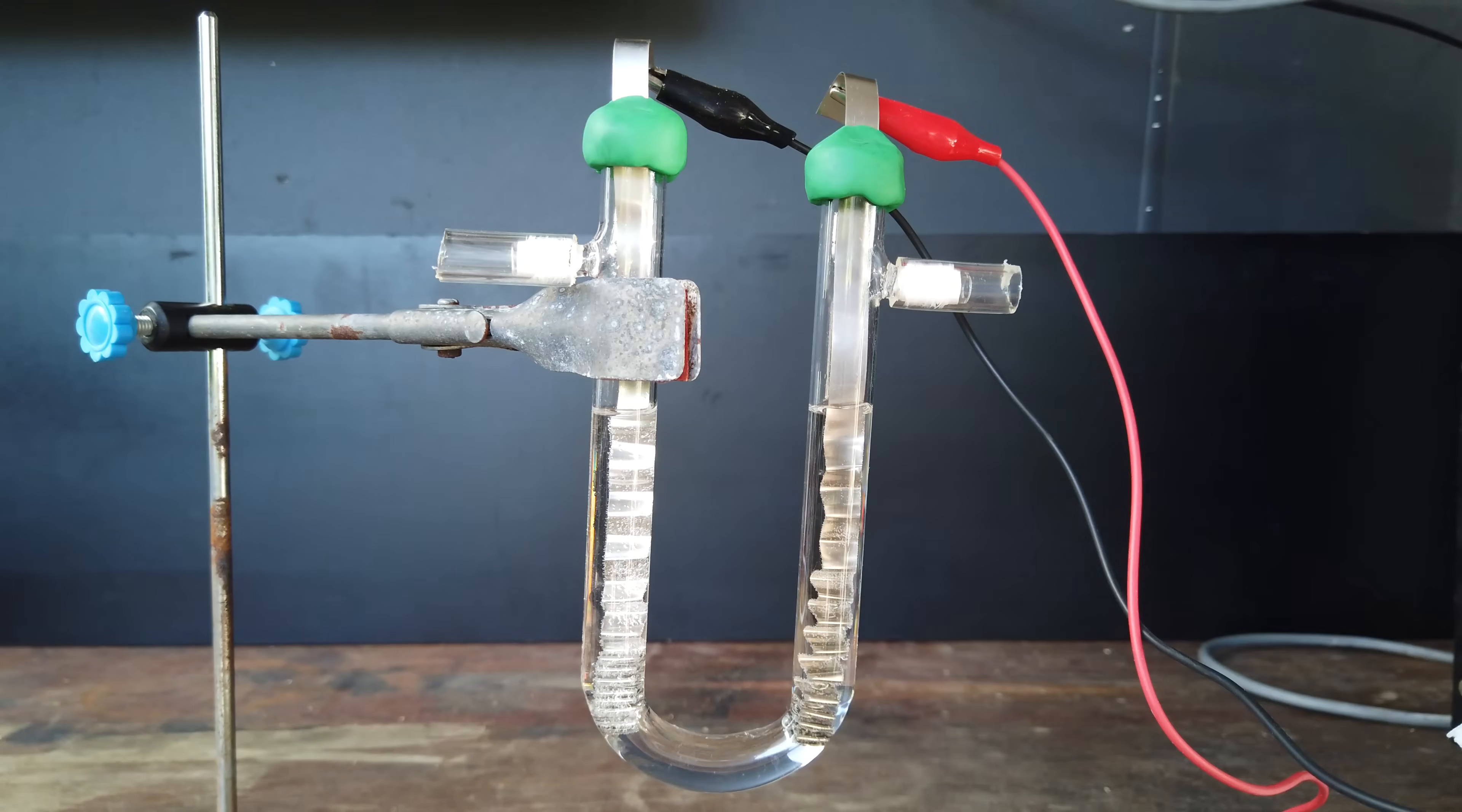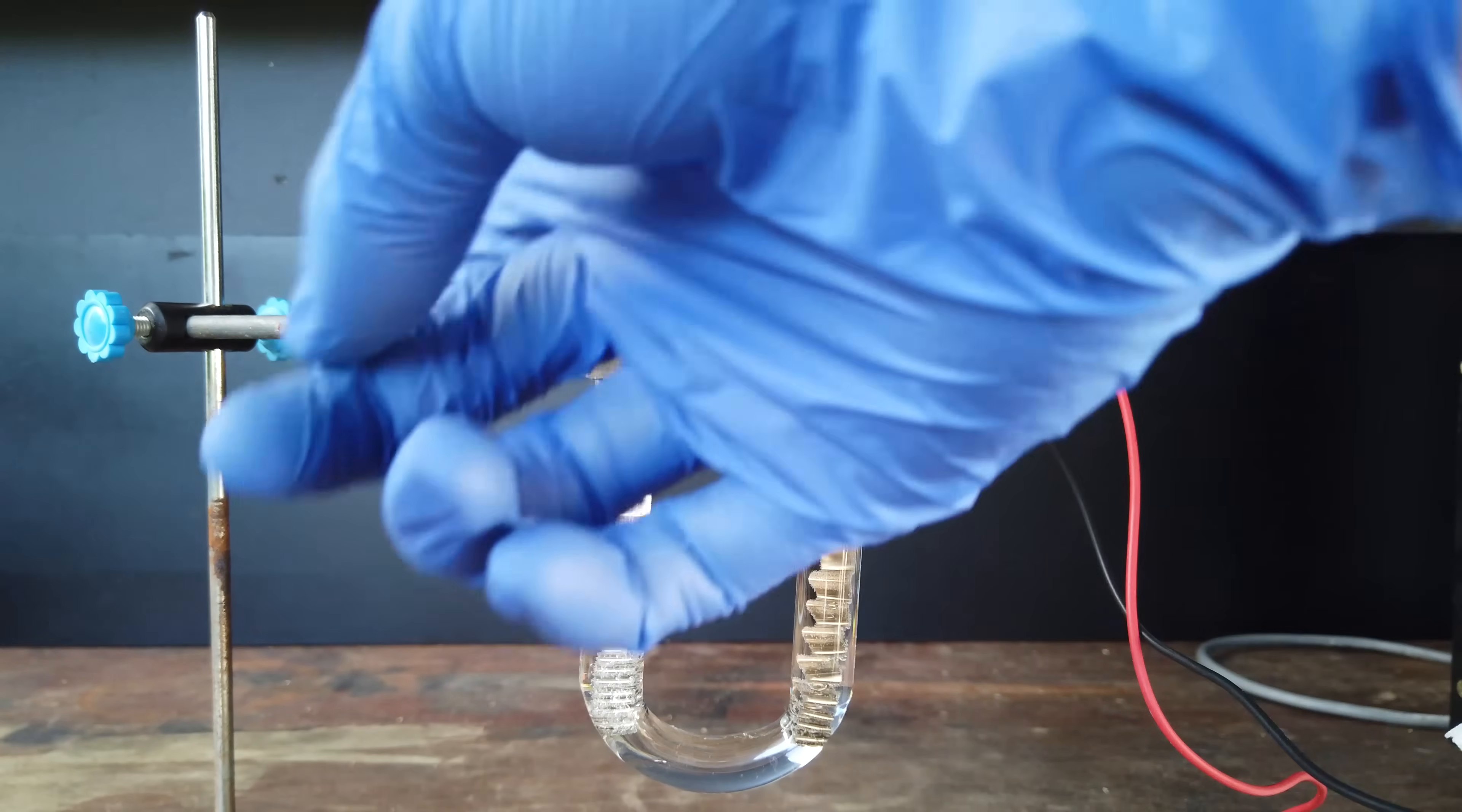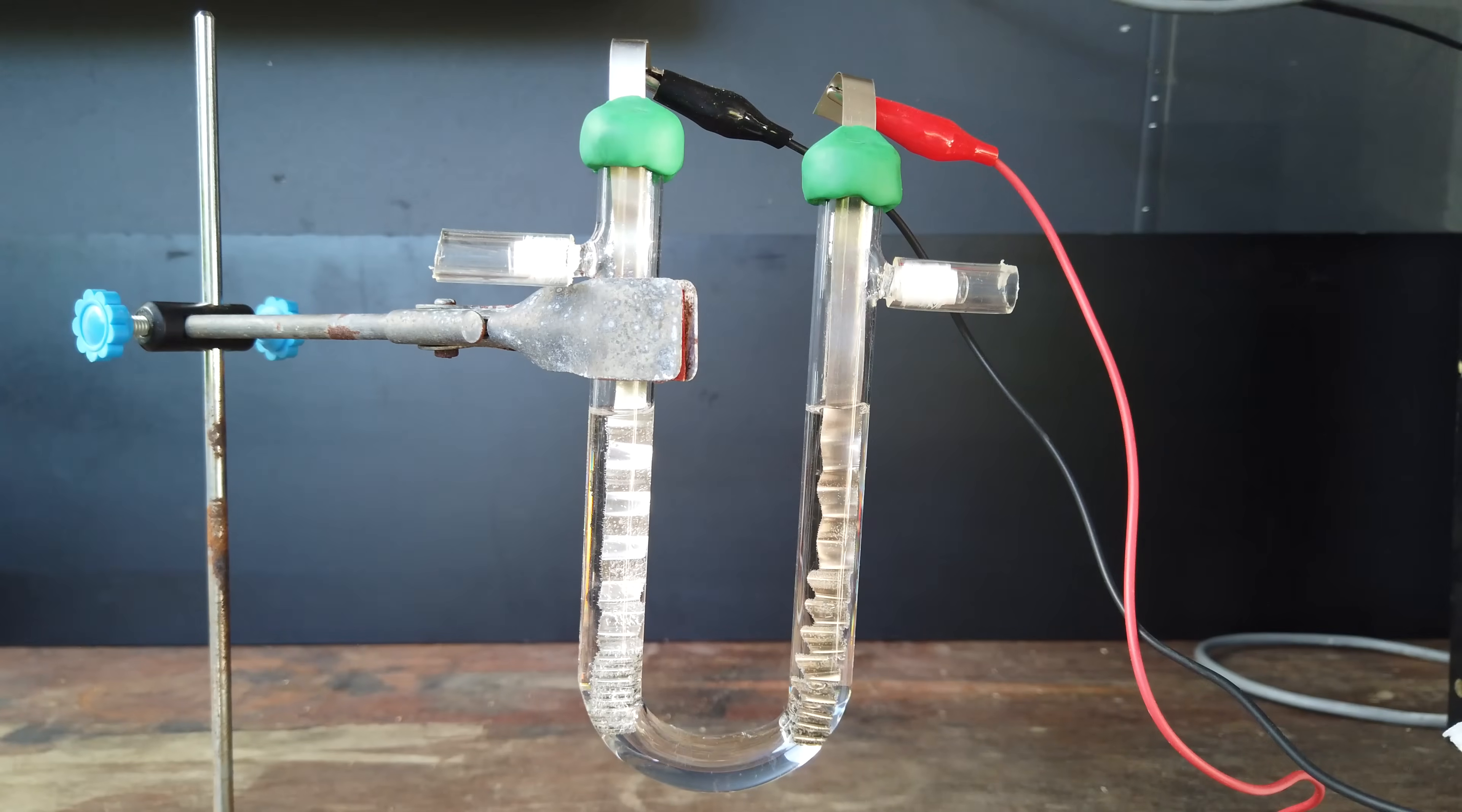Anyway, while this is slowly building up in terms of the current that we're drawing, I will connect up some tubing to either one of these gas takeoff tubes, and we will get ourselves ready to eventually collect the gases.